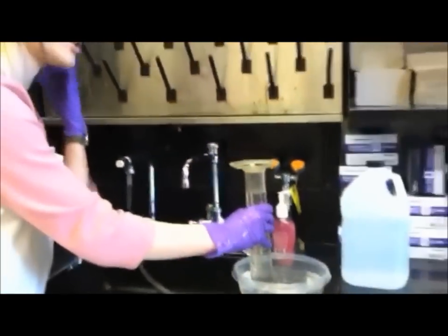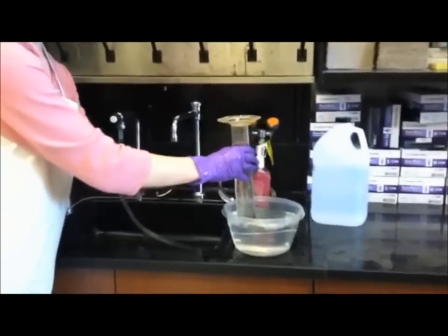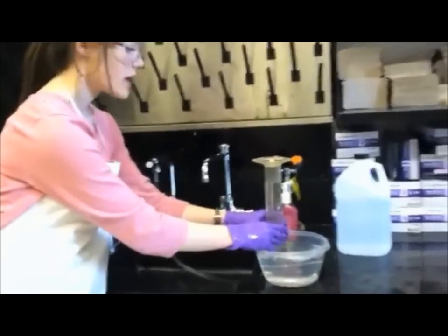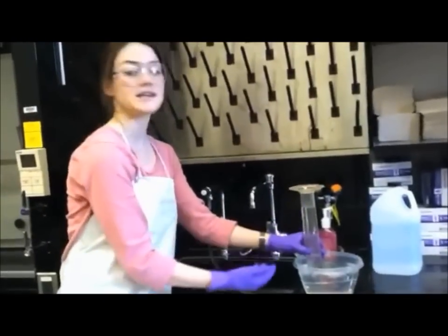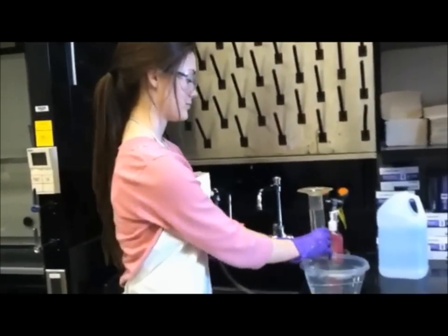However, make sure you do not get too large of an air bubble because you do not know for your first trial how much gas the magnesium will exert.